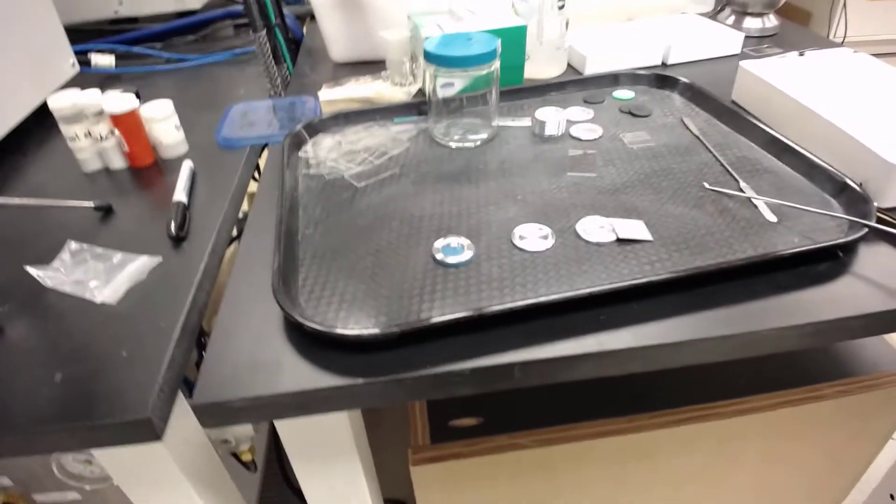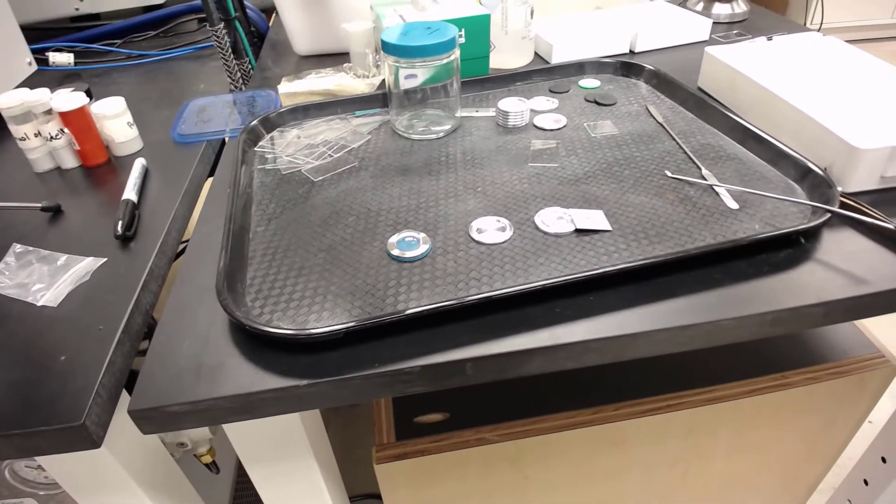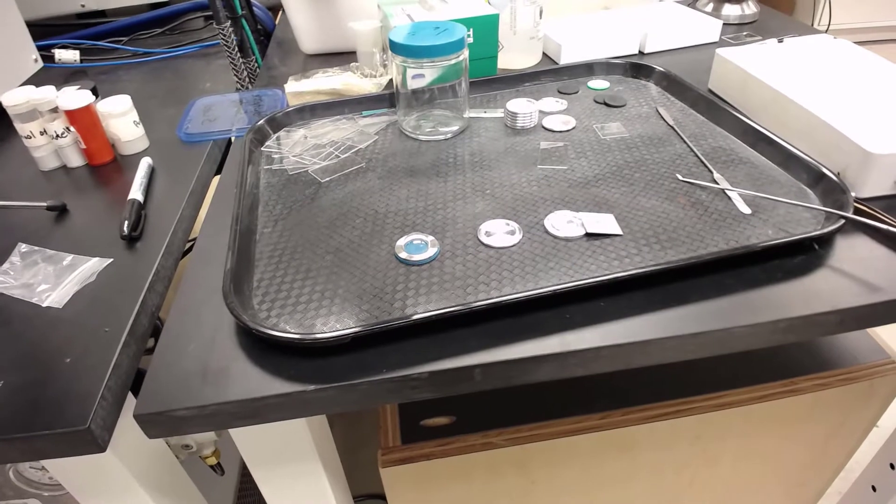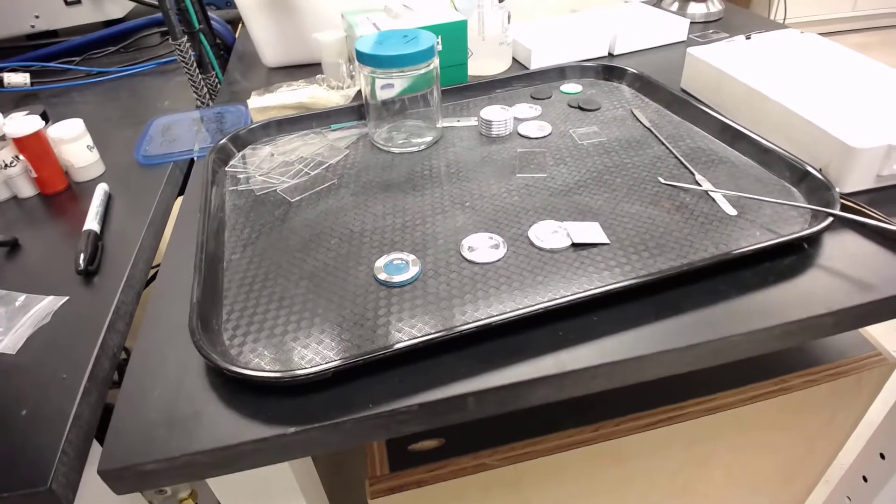Hello and welcome to XRD for the Modified Iron and Copper Lab. First I'm going to show you the sample prep procedure which is very straightforward for these samples.